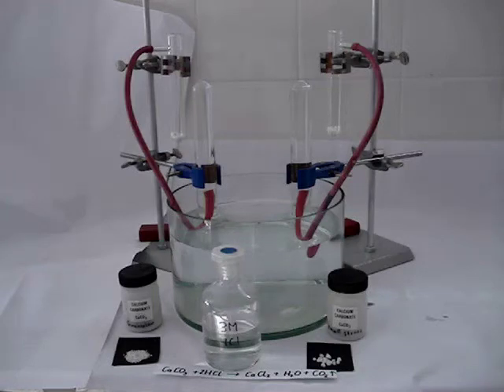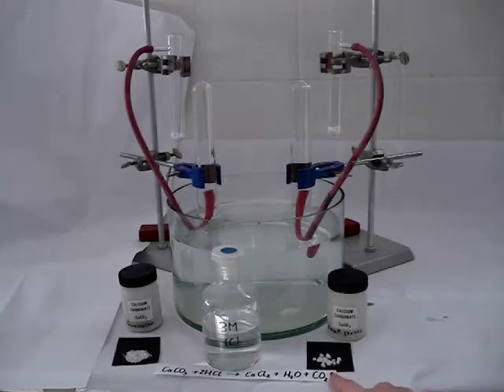We are going to demonstrate the effect of surface area on reaction rate. To do so, we are going to use the reaction of calcium carbonate with hydrochloric acid. In the process, carbon dioxide gas is produced.